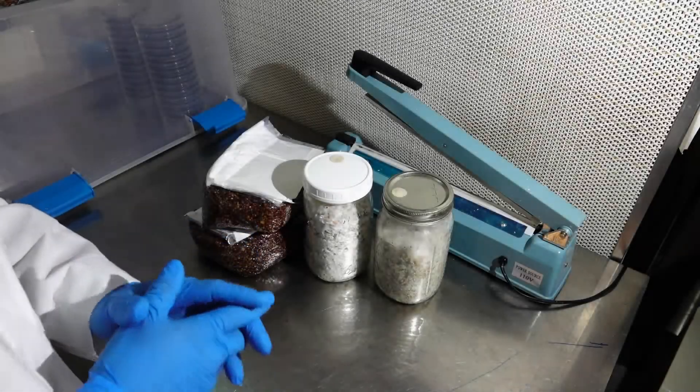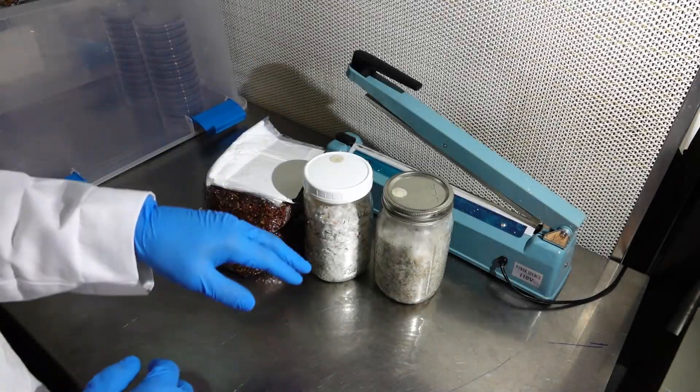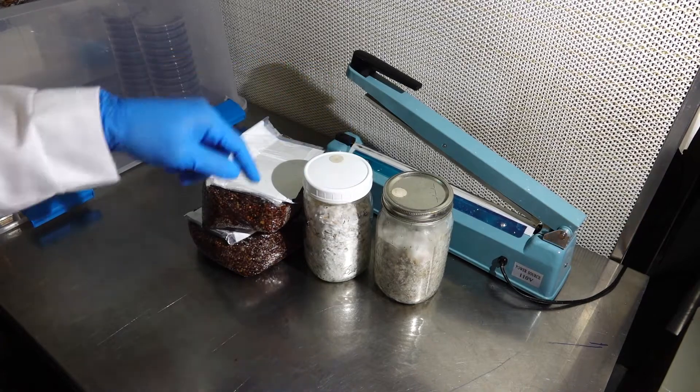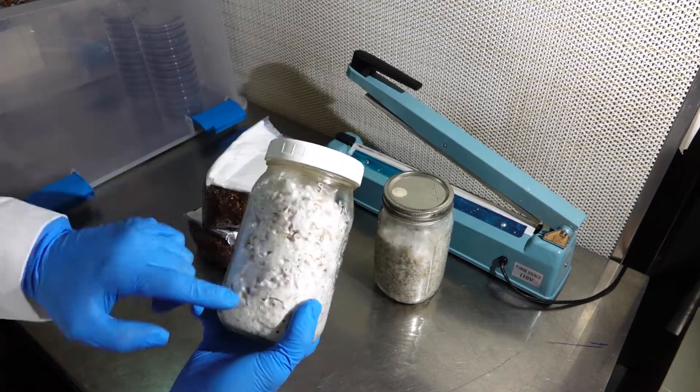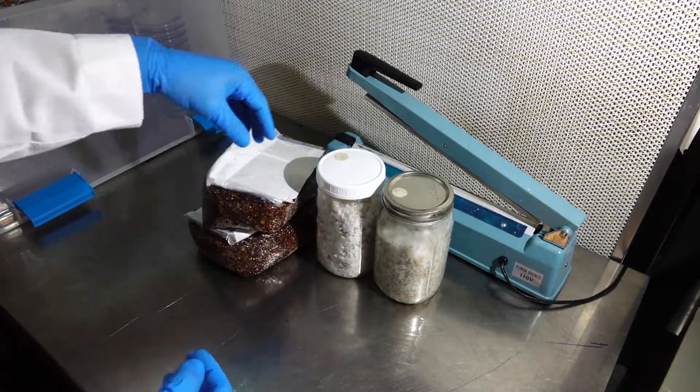Hello friends, welcome to the Picking Fruits channel. We are back in the lab. In this video I will be showing you how to make a grain to grain transfer using colonized grain in a jar, and we'll be transferring it into sterile grain in a mushroom bag.